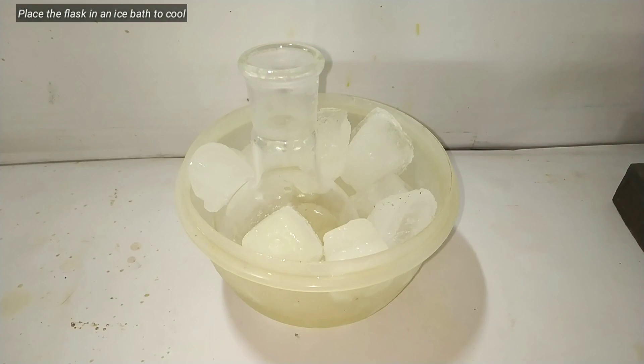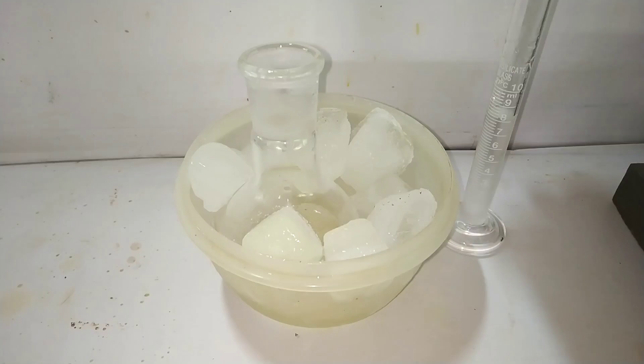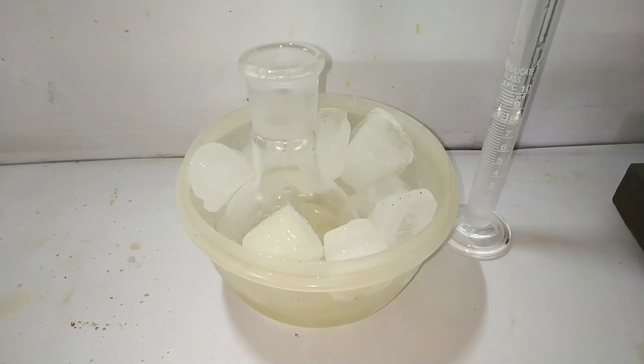Now place the flask in an ice bath to cool to 0 degrees Celsius. Meanwhile, prepare a sodium hydroxide solution of 3 molar concentration and cool that solution. Take 8 milliliters of that solution in a measuring cylinder.